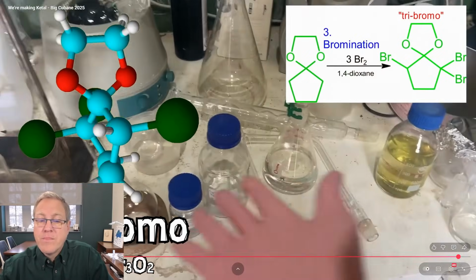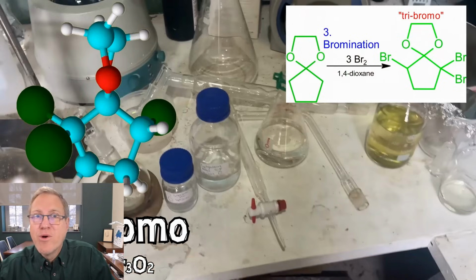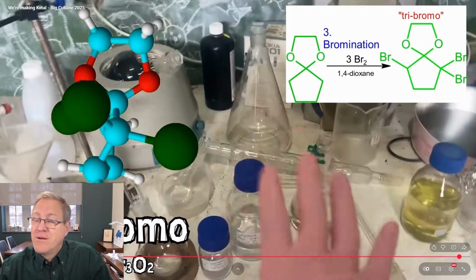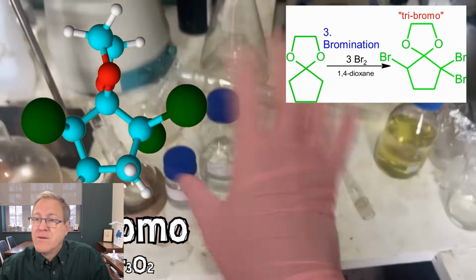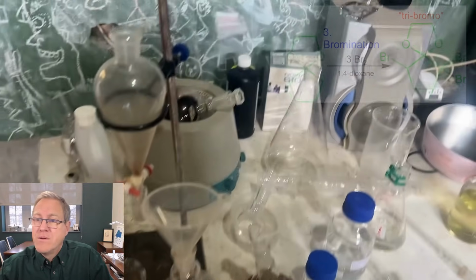We need 600 grams or so of bromine, which is... I'm totally going to react to this tribromo reaction. This is cool chemistry. Absolutely. Already quite a bit, but I would have liked a little bit more. I definitely didn't really want to have to do this ever again. You know, I'm always hitting it with these low yields, actually.